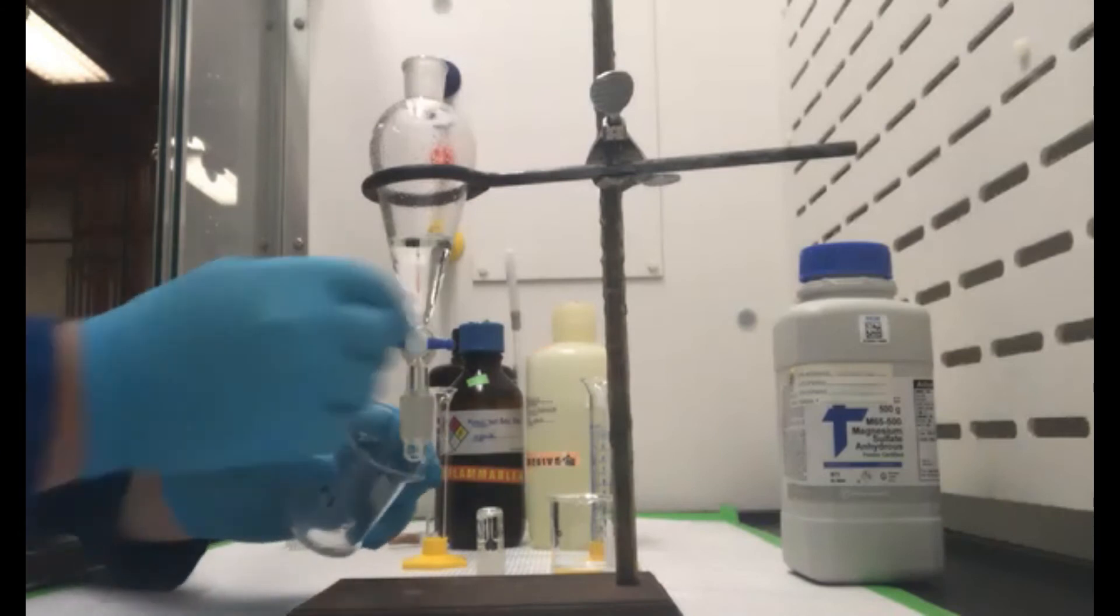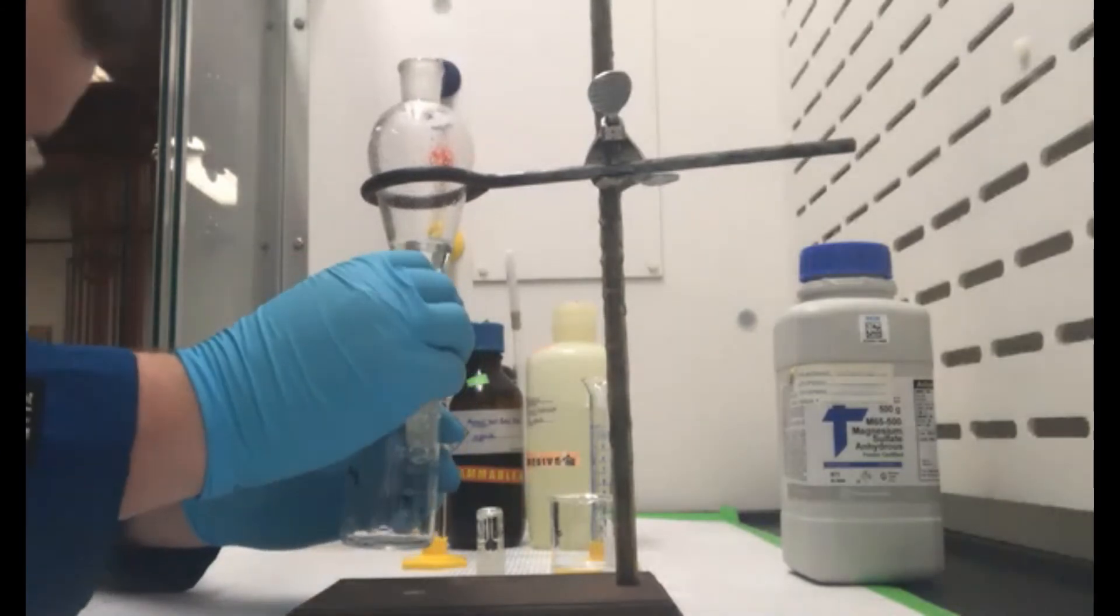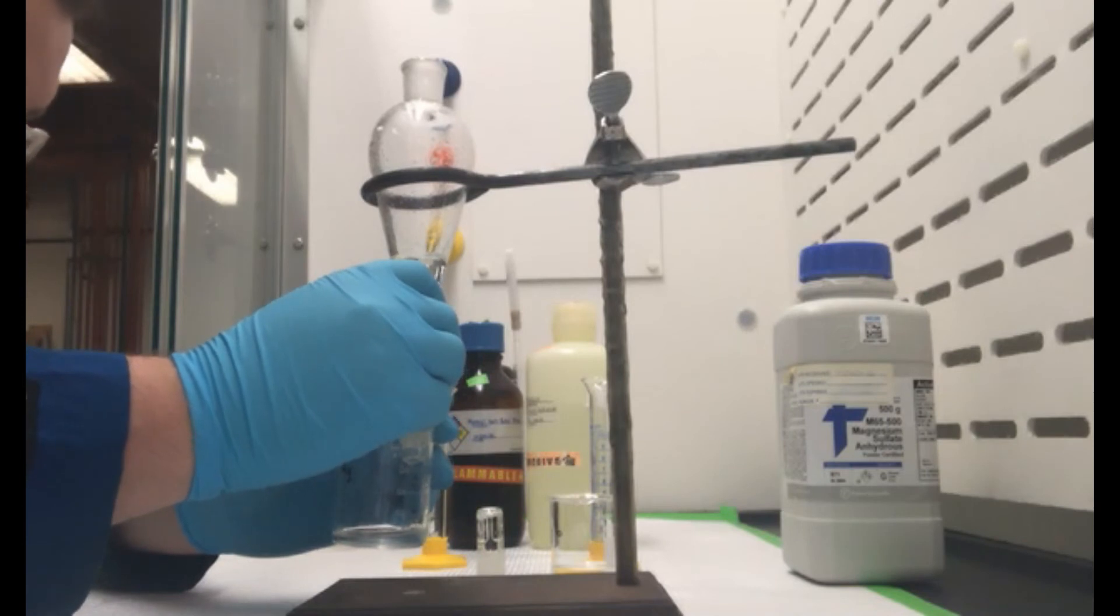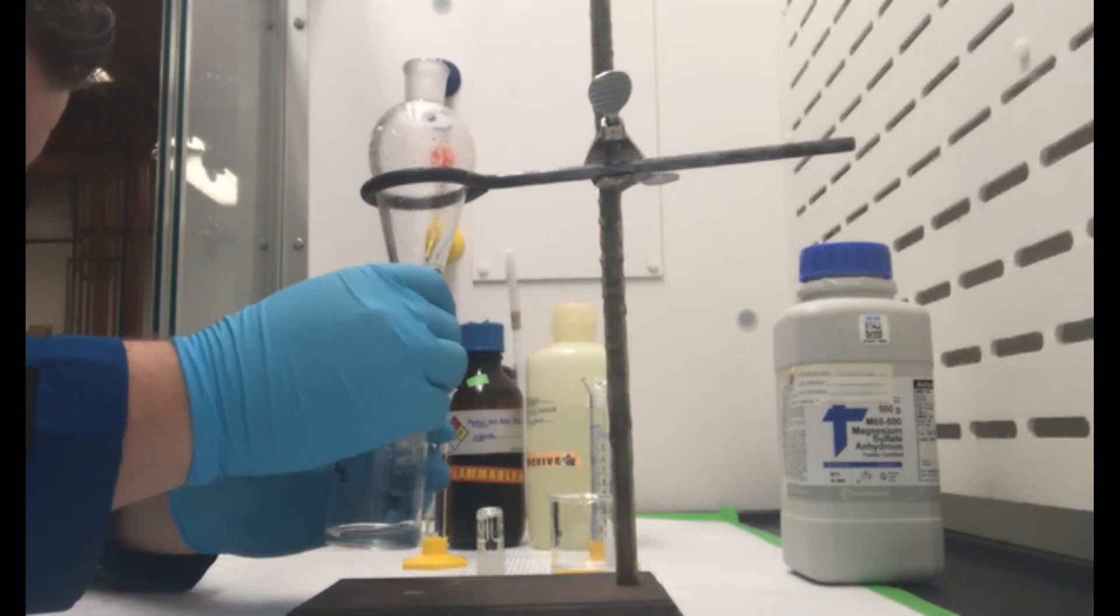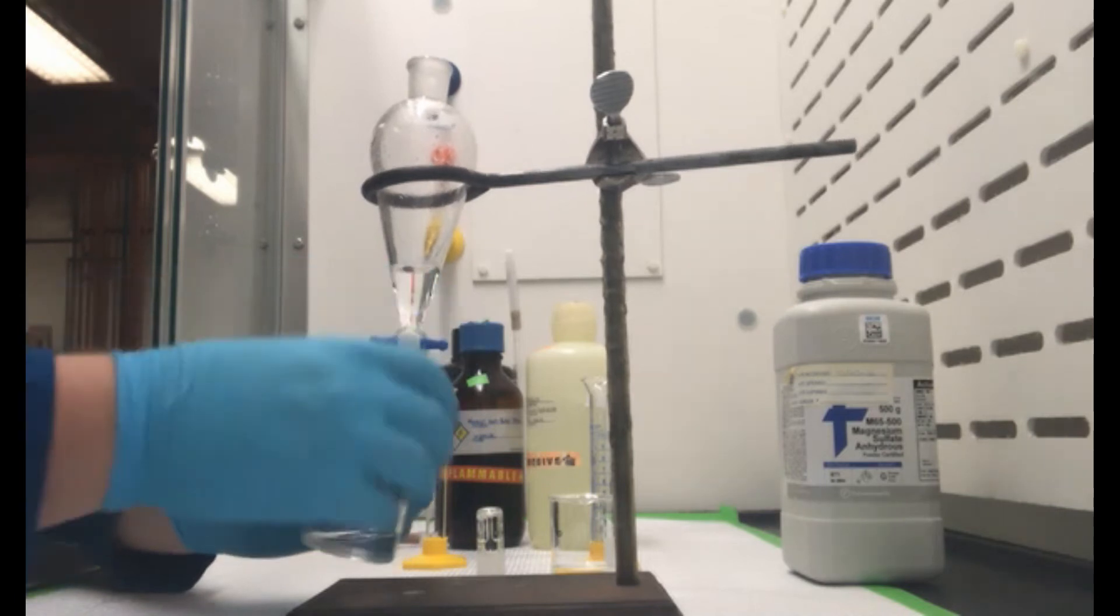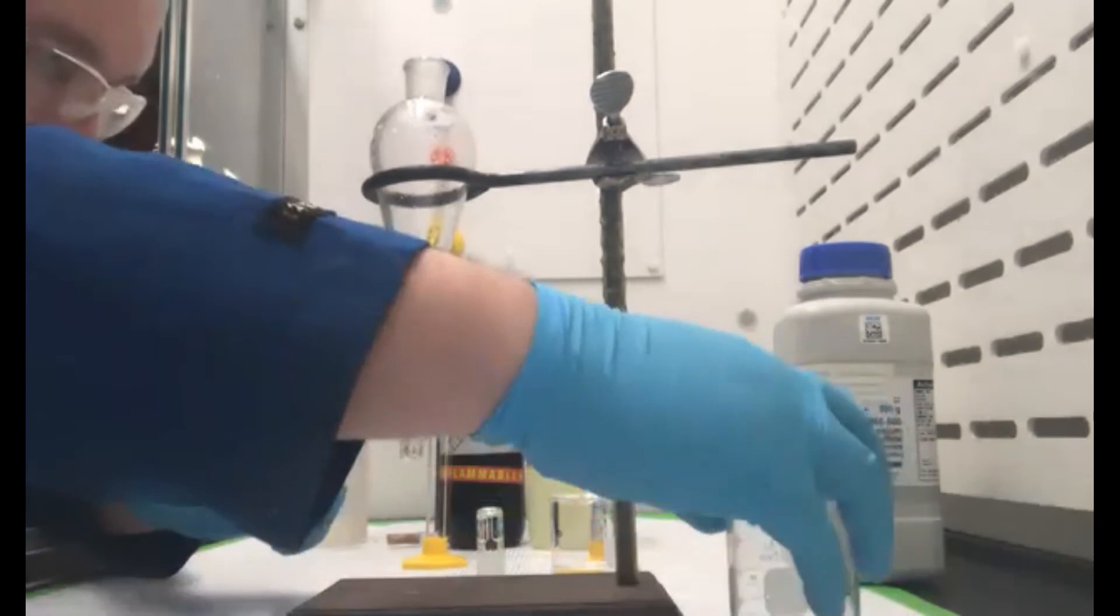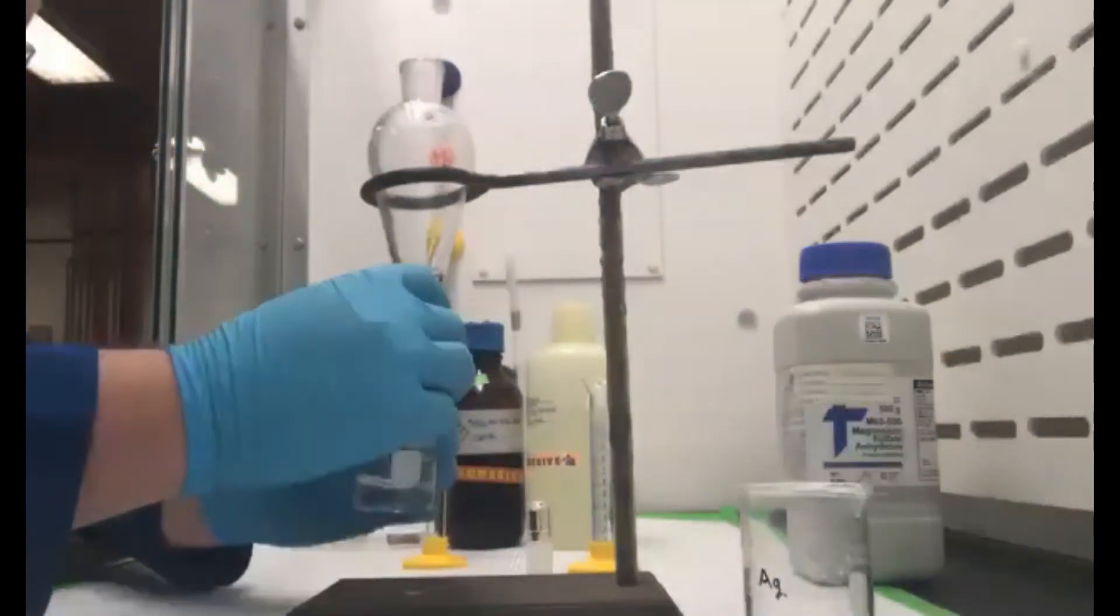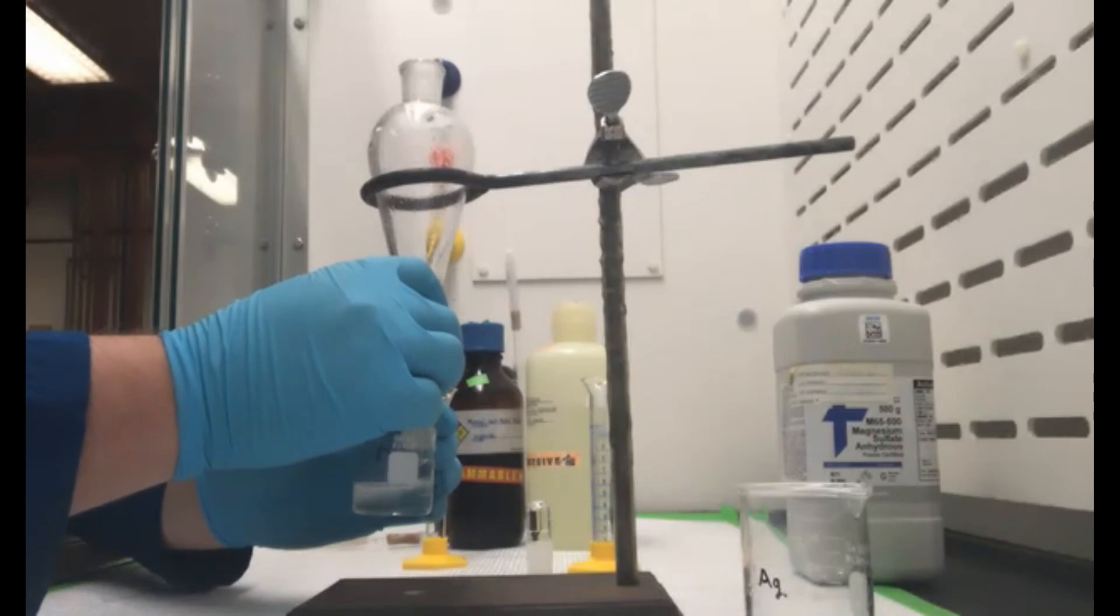All right, so layers have separated, so I'm going to go ahead and remove the aqueous layer here. I'm going to set that aside. I don't want to throw it away just yet. Now we'll go ahead and combine this organic layer with our other one.